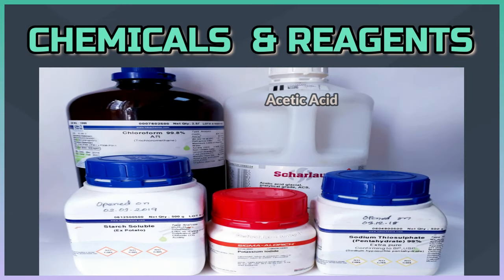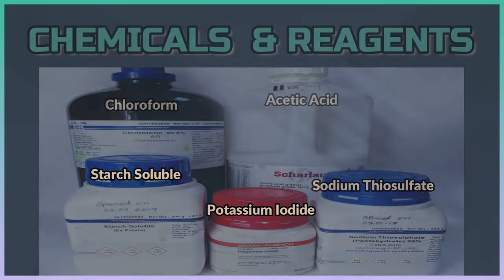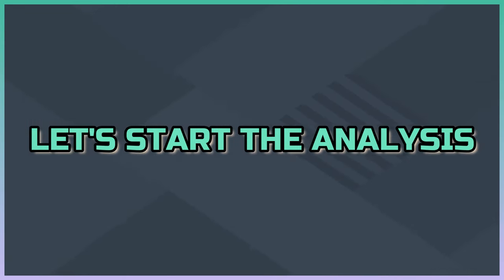Among the chemicals we need acetic acid, chloroform, sodium thiosulfate, starch, and potassium iodide. Let's start the analysis.